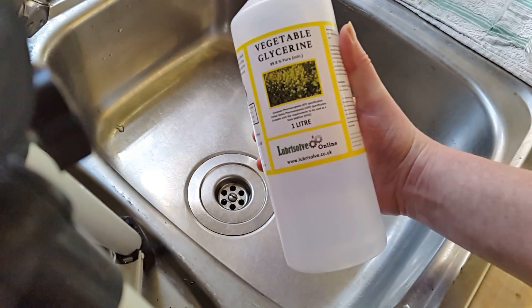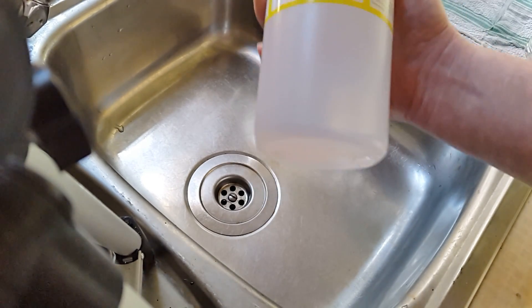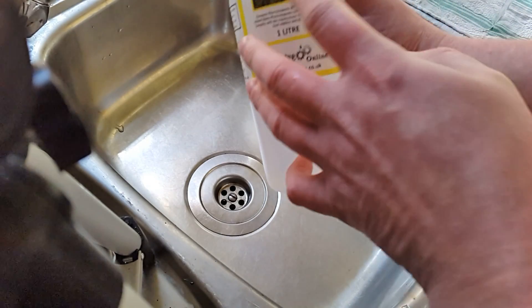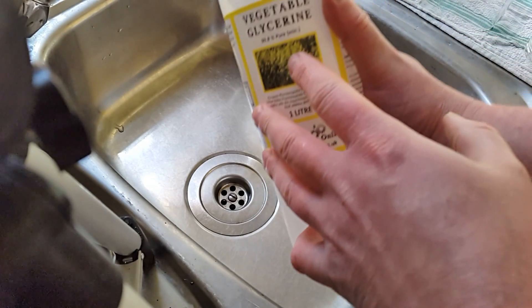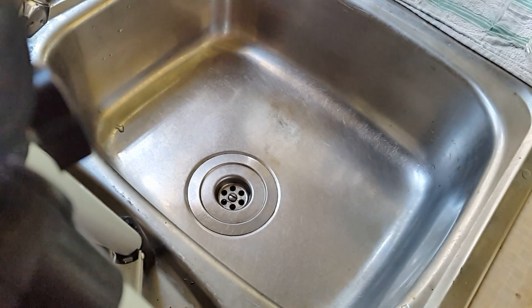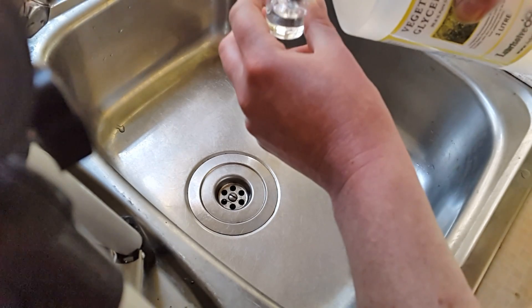What we got here: vegetable glycerin. There's a massive surplus of this in the world, apparently, because of biodiesel — it's a by-product, so it's dead cheap. 99.8% pure minimum. It's used in cooking and so on. We'll give this a try. Let's give this a go.